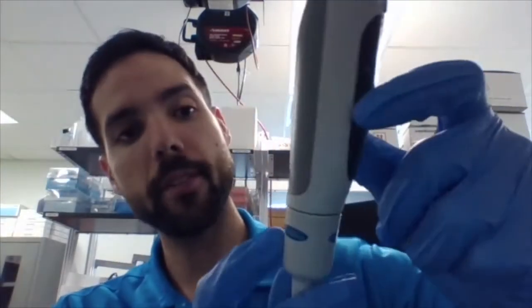Now that I'm done adjusting the volume, I'm going to press down and lock my volume in place of 50. So this is now ready. So it is within range, because it is 10 to 100. I have adjusted it to 50.